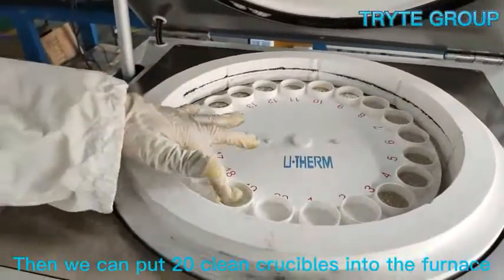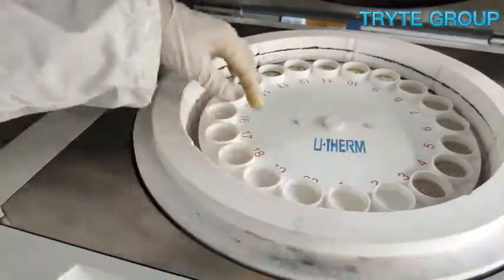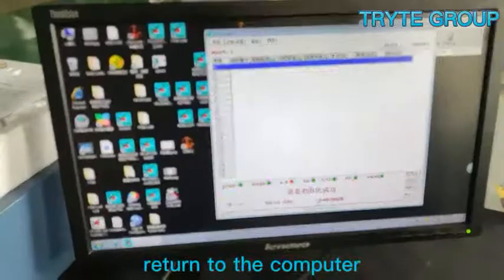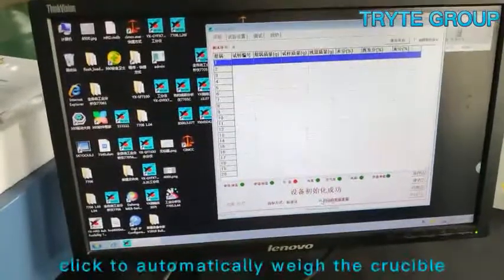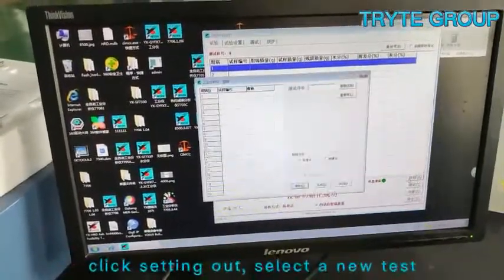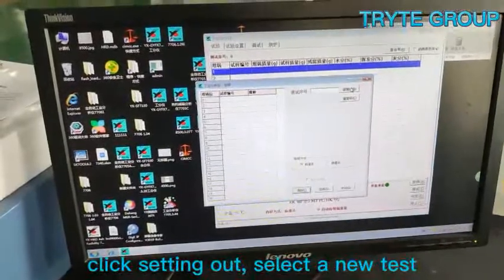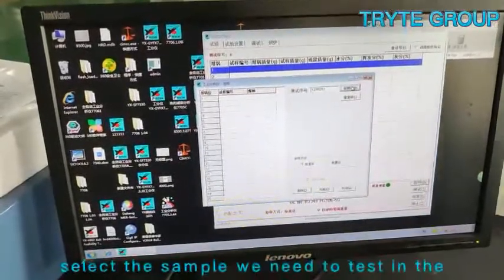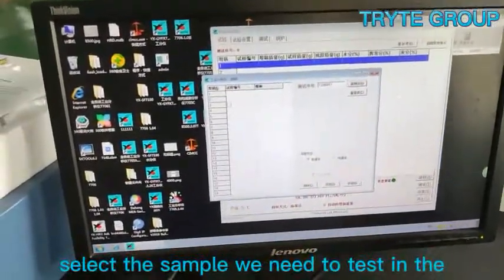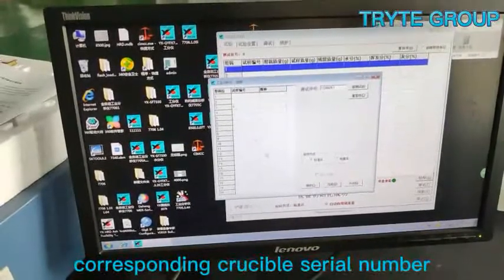Then we can put 20 clean crucibles into the furnace. Return to the computer, click to automatically weigh the crucible, click setting out, and select a new test. Select the sample we need to test in the corresponding crucible serial number.